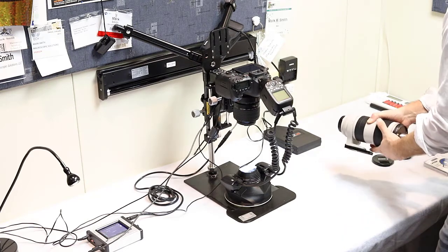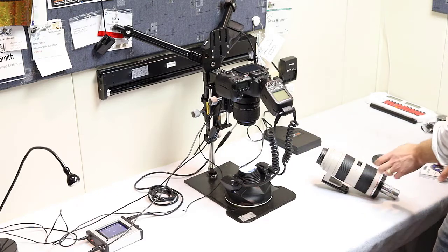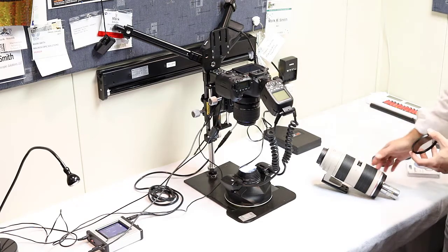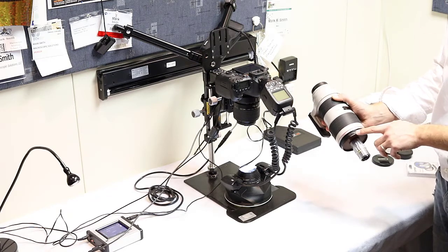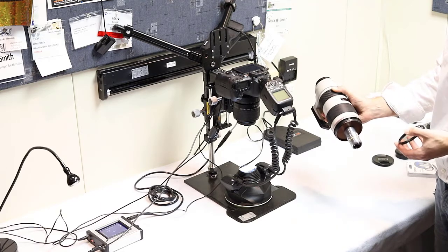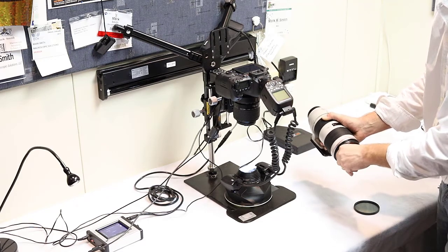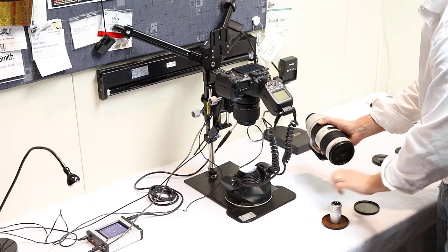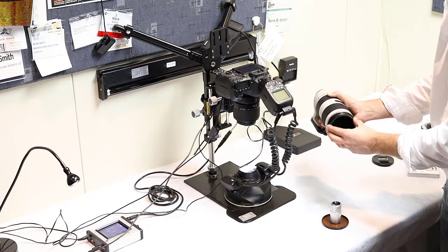The other thing to do, again, not so relevant for biologists, but more relevant for geologists. There's 2 ways you can add the polarizer if you need to cross polarize your light. One is, if you don't want to touch or change your position of the thin section or risk moving it, you just unscrew the adapter, screw on the polarizer, and then put the adapter back on over the polarizer. So basically just like this, you'll just take off the adapter. Again, 2 hands, be very gentle with this objective. Set that down, you'll add your polarizer, and you can do this with it mounted on your camera as well.